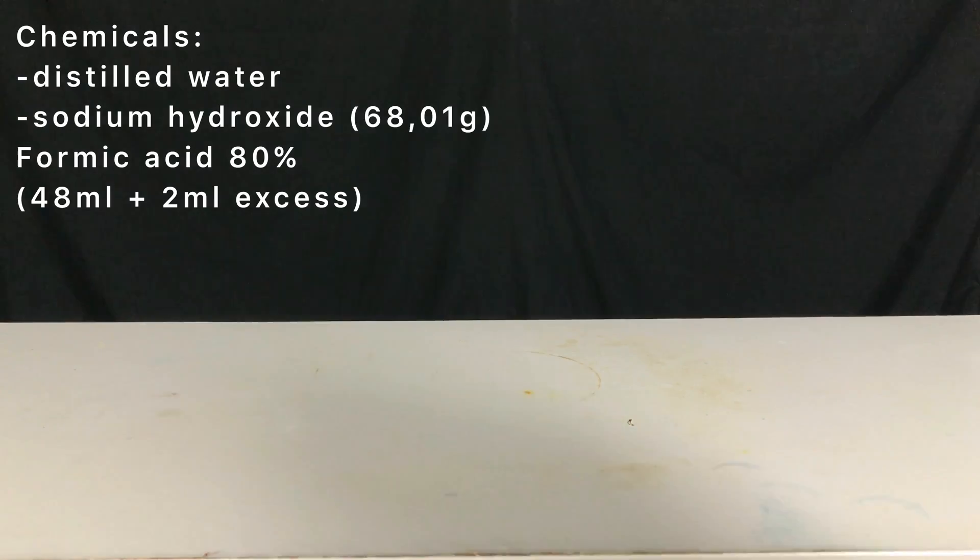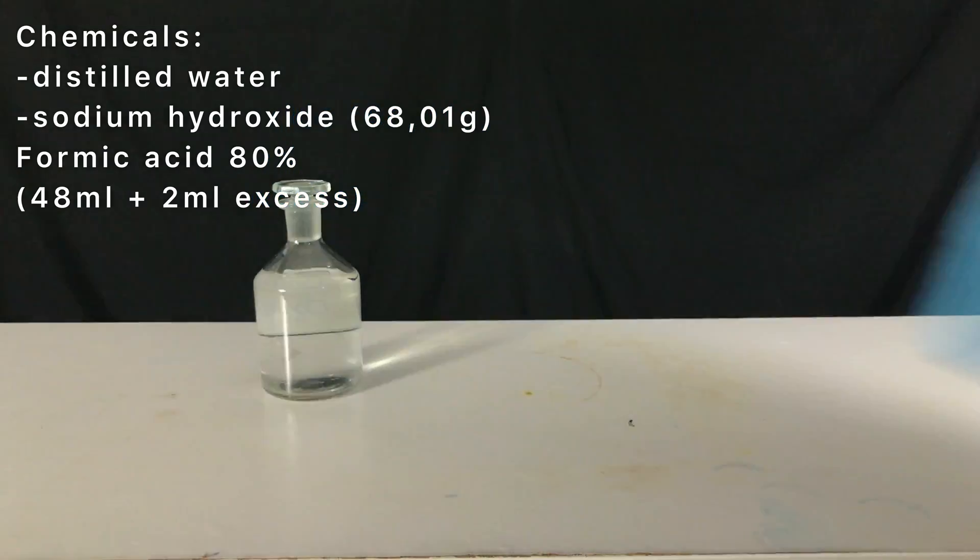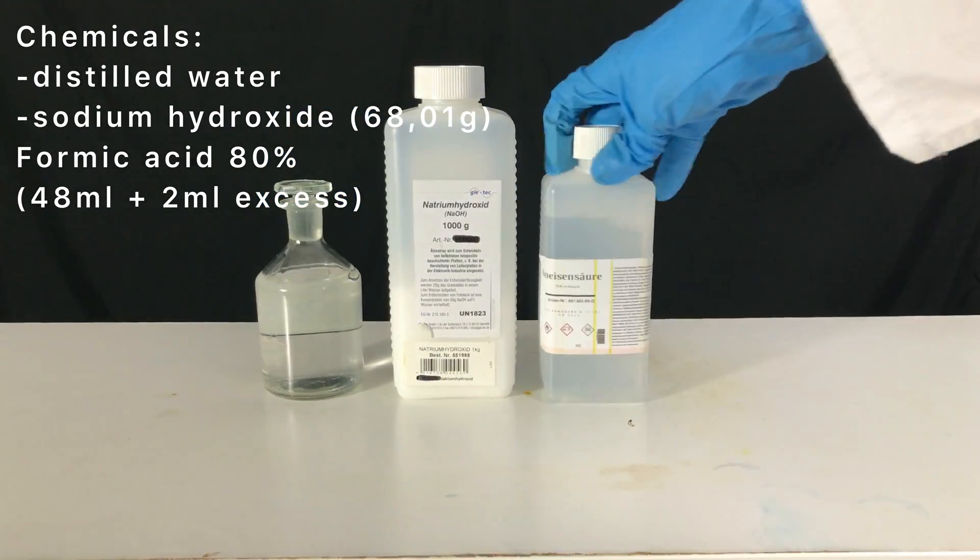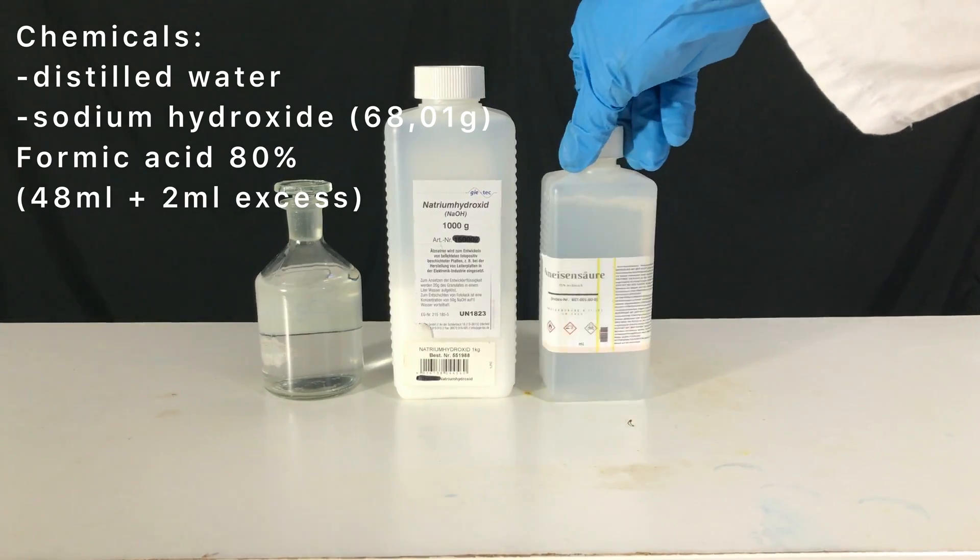Welcome back everyone for today's preparation. Distilled water, sodium hydroxide and 80% formic acid are needed.